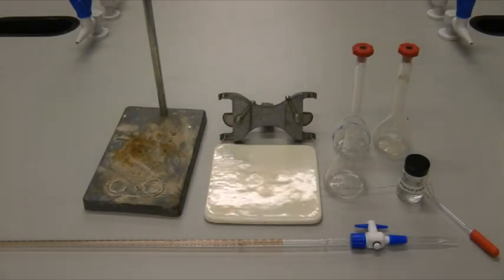Titration is a common technique used in volumetric analysis. Classically, it involves a burette and is normally employed when you have one solution of known volume and concentration and another solution of known volume but unknown concentration.